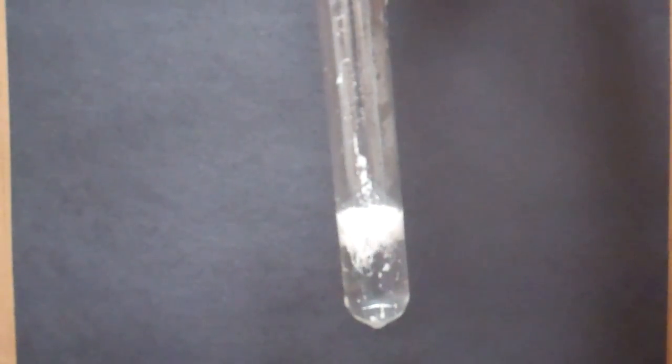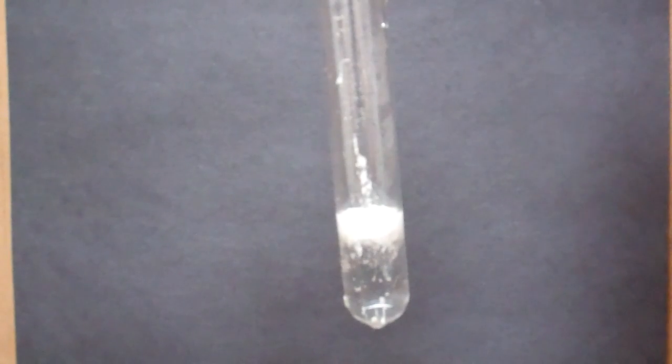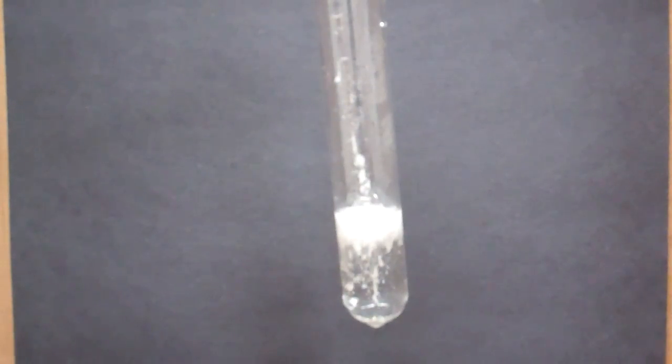If your substance contains lead then this is what you should witness occurring. It will make a snowy white precipitate.